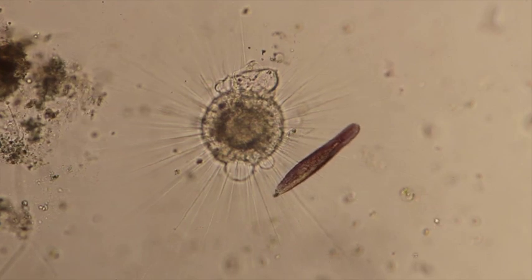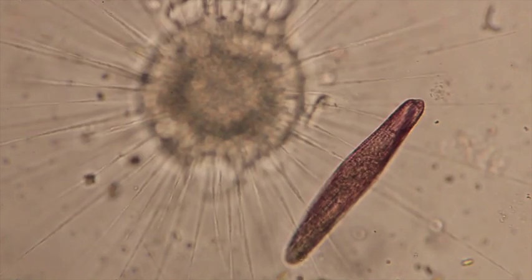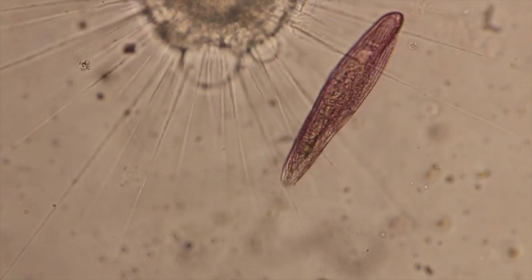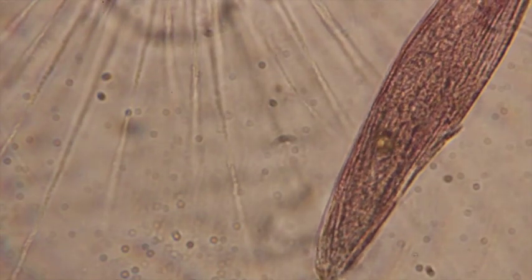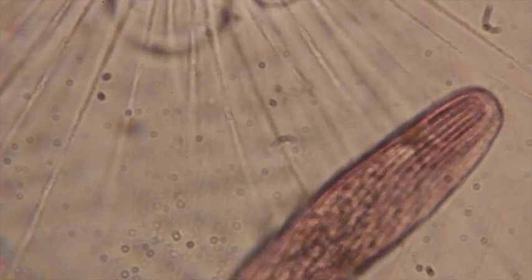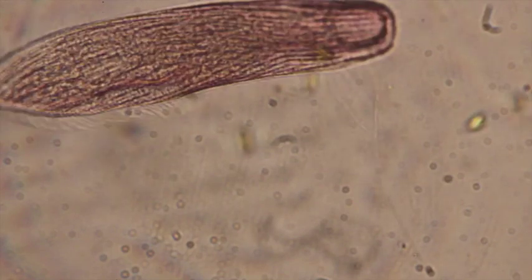Now we can see here that we have a blepharisma, which is a ciliate. These actinosphaerium feed by basically having sticky components on their axopods, and those sticky components collect various organisms. Here the blepharisma is either stuck to it, but more likely the blepharisma is actually in there feeding off of the little axopods on the actinosphaerium. Here you can see that the blepharisma is just kind of moving around slowly, collecting all of those little organisms off of those axopods that the actinosphaerium is trying to eat.